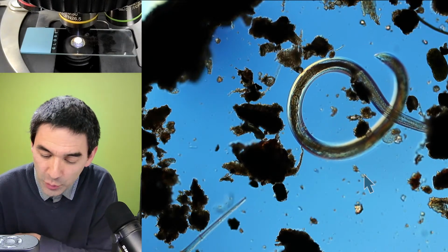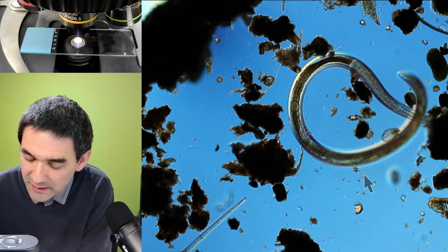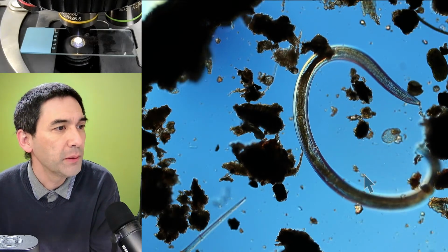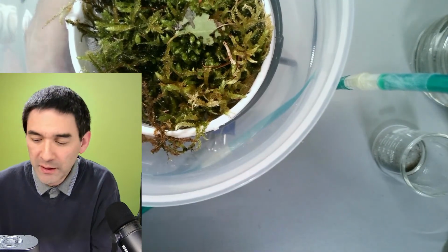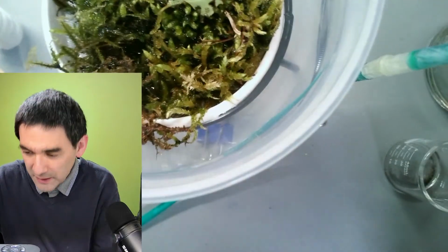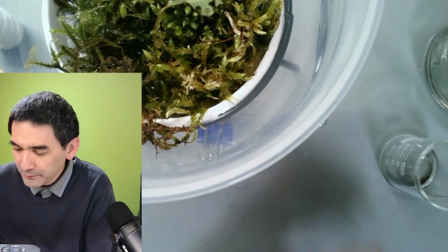What I will show you now is what I've made here. It's not the most perfect design, but I just would like to show you what it is. This is basically what you have over here. Now, that's the problem that I have, it's the top view. I'm going to put some of the things here to the side. I'm going to quickly show you the side view.